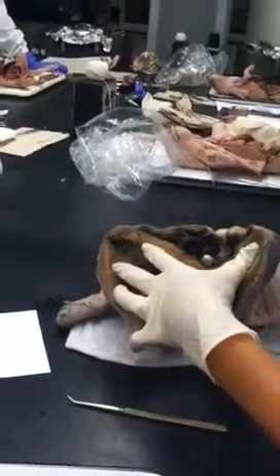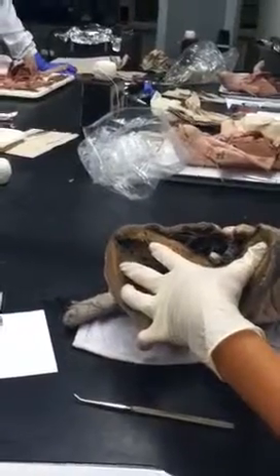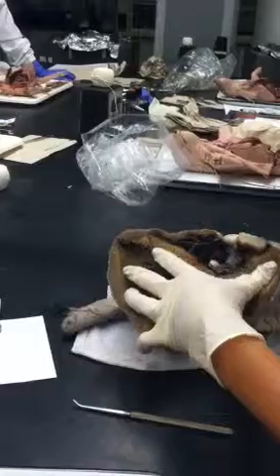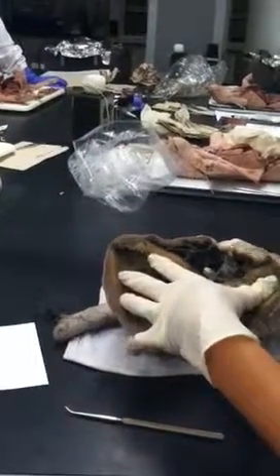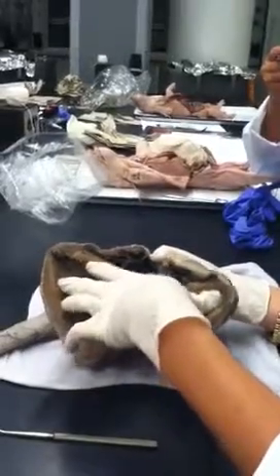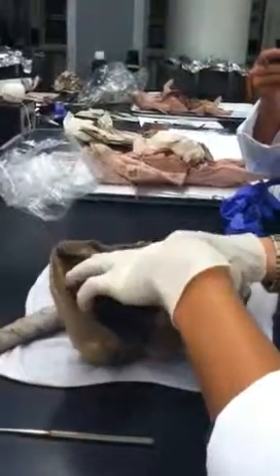So this valve would be the bicuspid or the tricuspid? Tricuspid. Good. Tri because it's right, so it makes you think of right. Okay, so my finger's through the cranial vena cava. It's now in the right atrium.